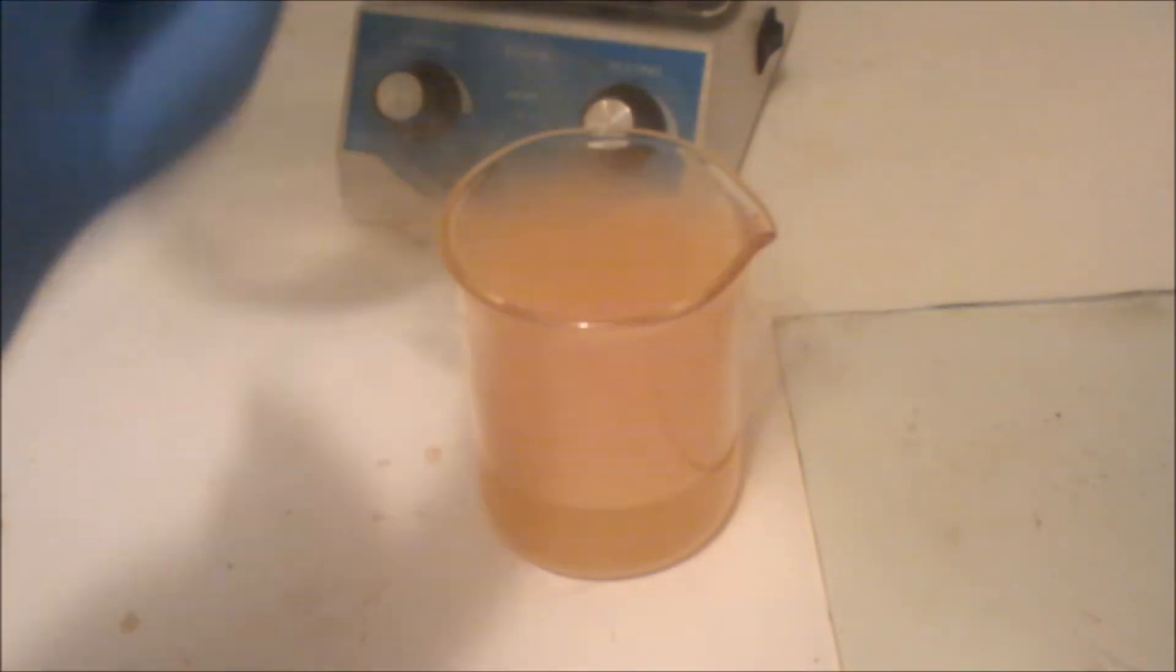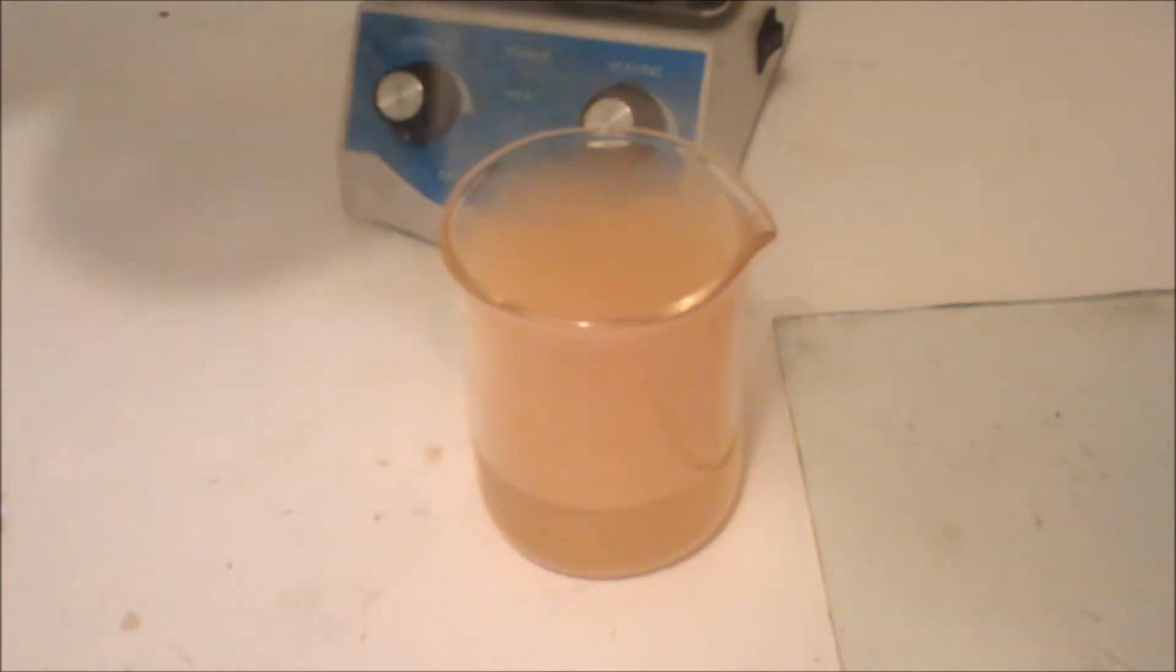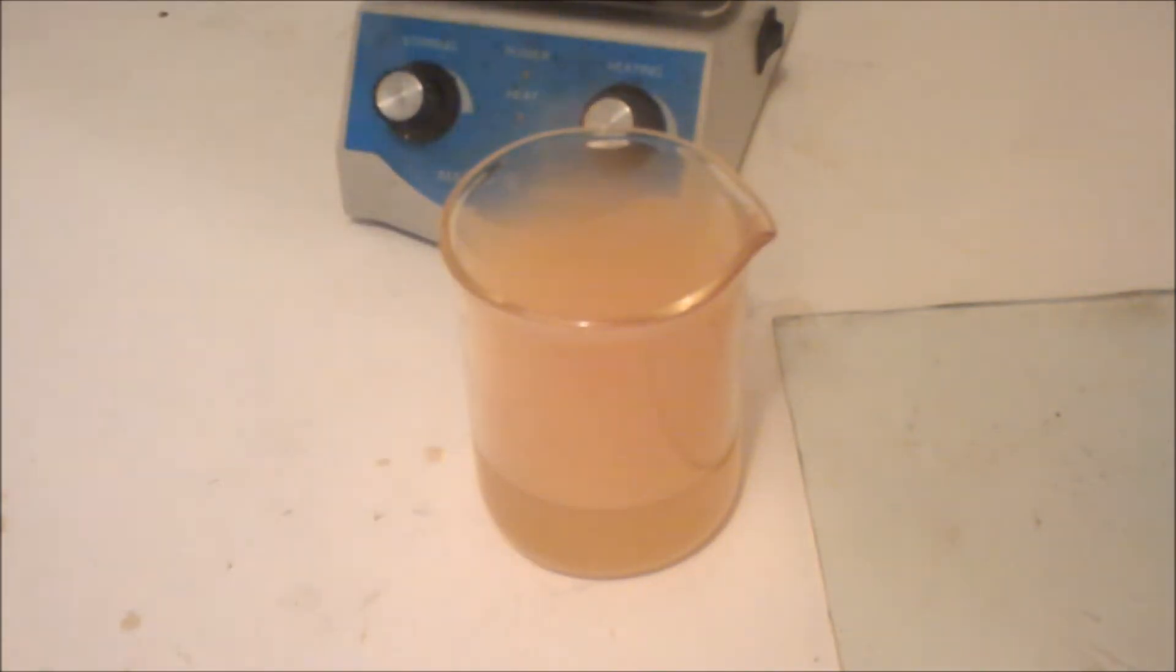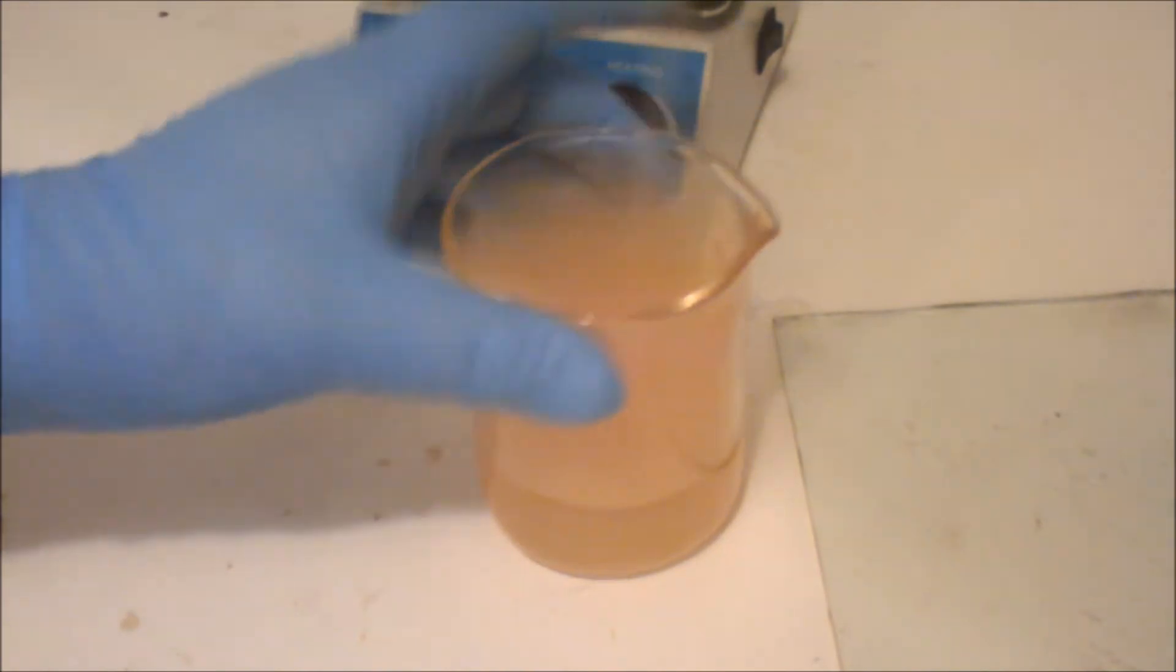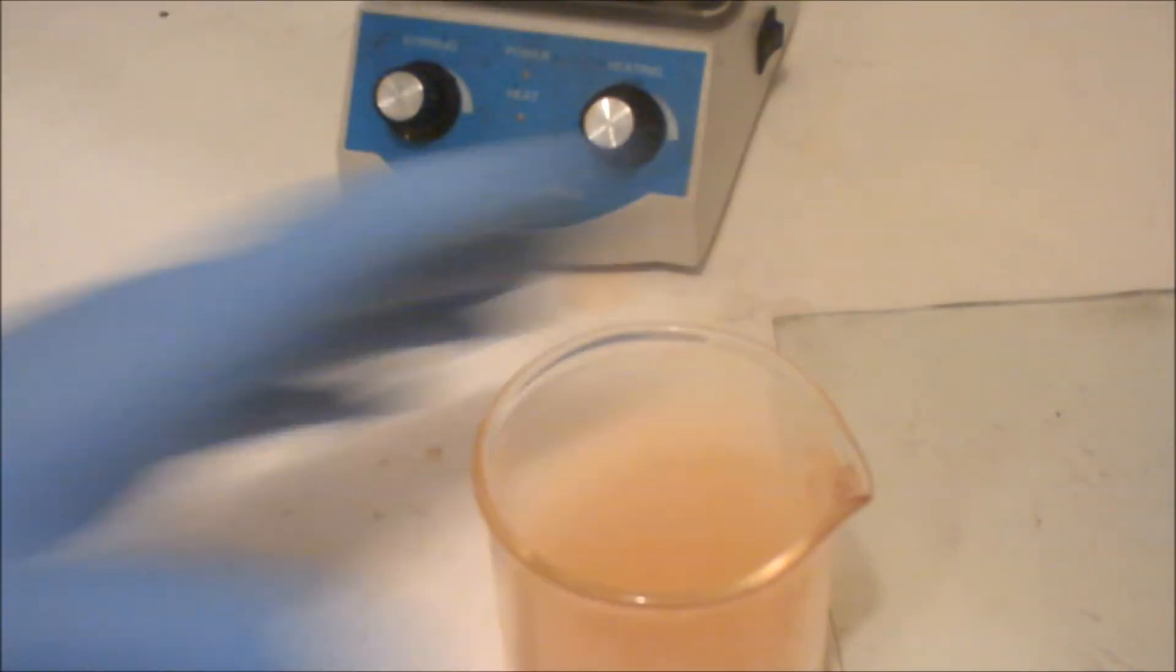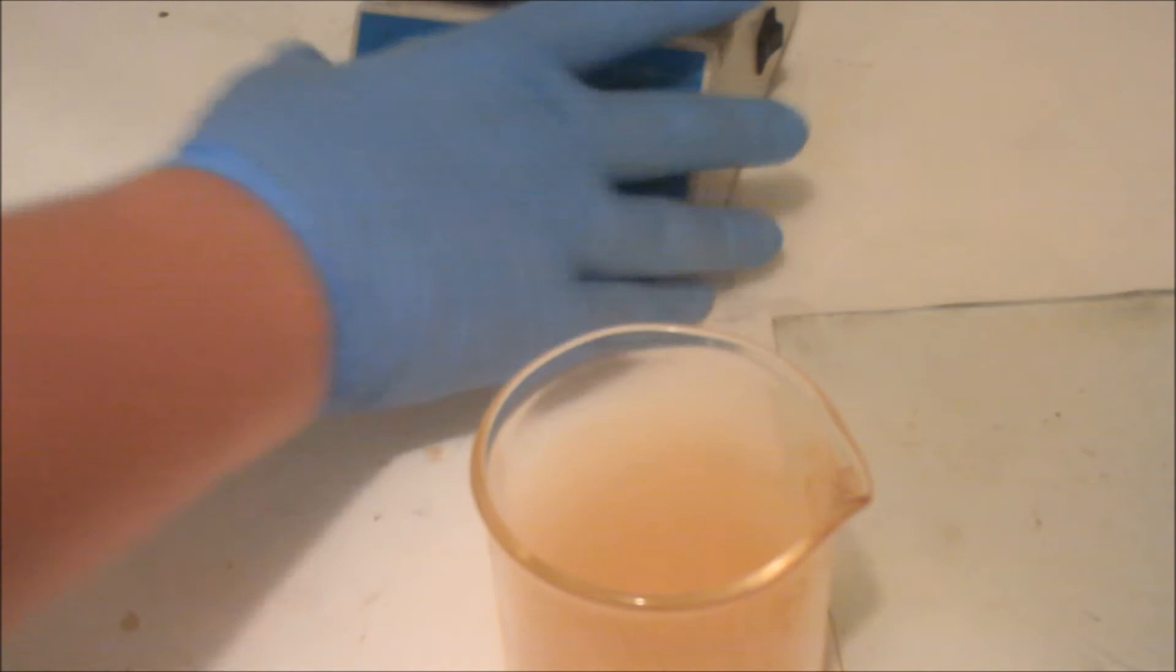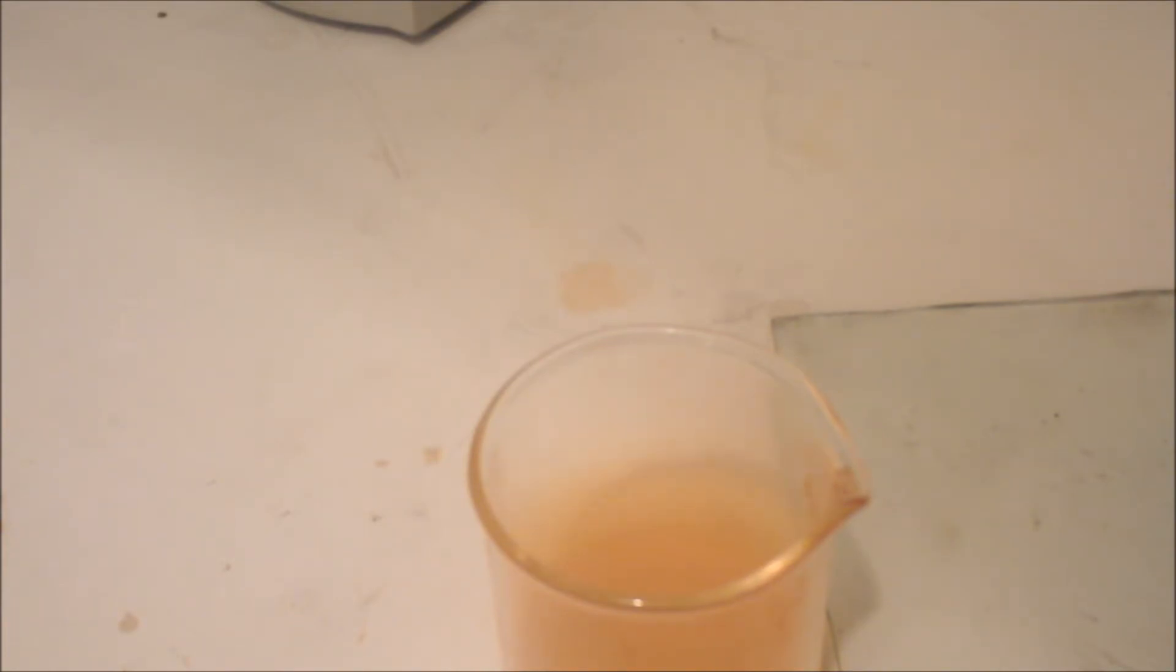I can tell by looking at this lead and by feeling it, there has been a lot of lead dissolved. Here's our lead nitrate solution. I'm going to move this back and grab a container of cool water to put this in.